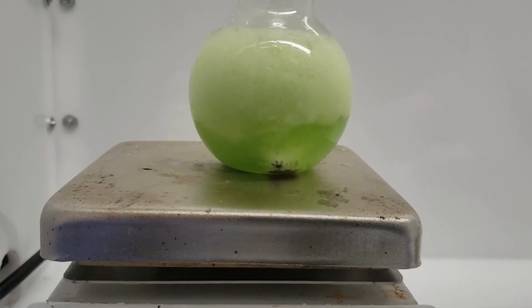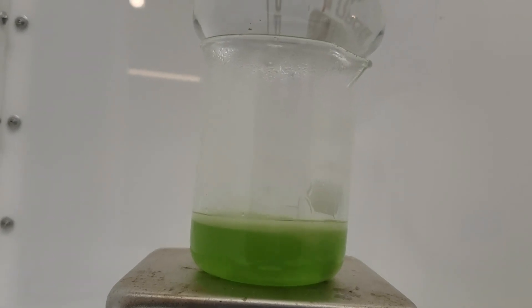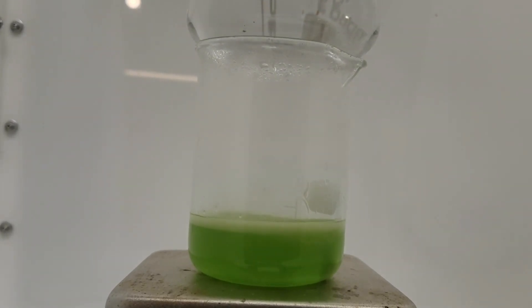Hi everybody, and welcome back. Today, I'll be demonstrating the synthesis of Praseodymium-3-Oxalate, a beautiful green rare earth compound of which no videos seem to exist.